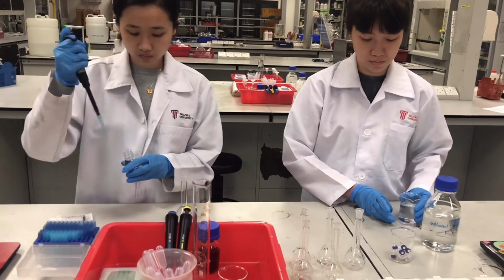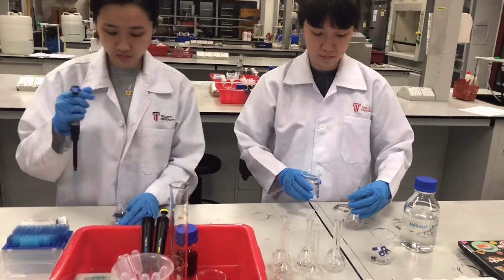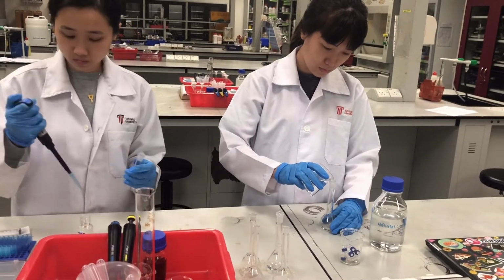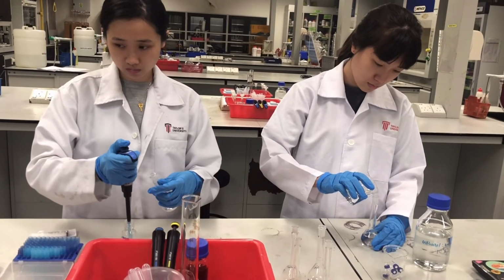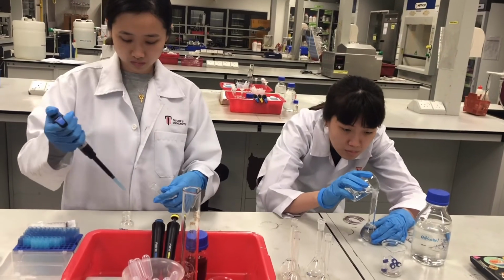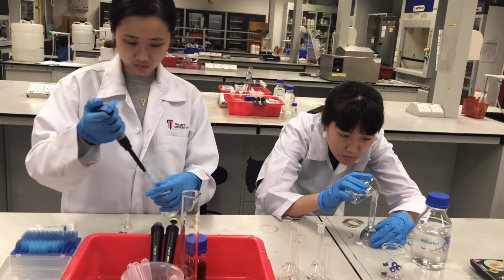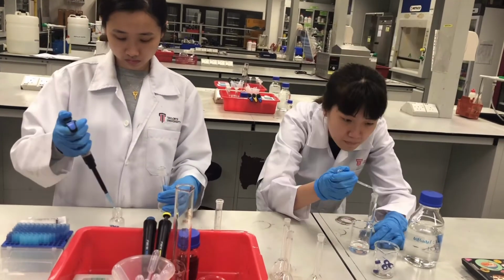For sample preparation, take 0.5 ml of tea into a volumetric flask and dilute it with mobile phase until 50 ml. And then prepare the standard using serial dilution. The concentrations of the standard solutions are 0.5 ppm, 1 ppm, 2 ppm, 4 ppm, and 8 ppm.